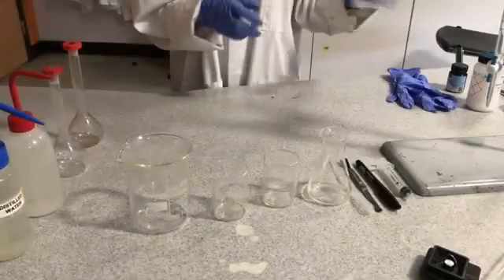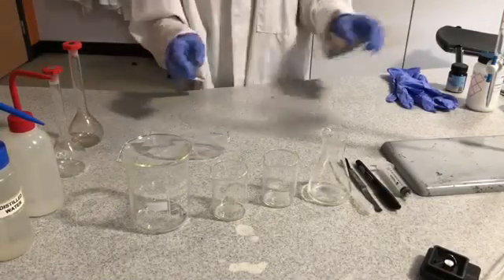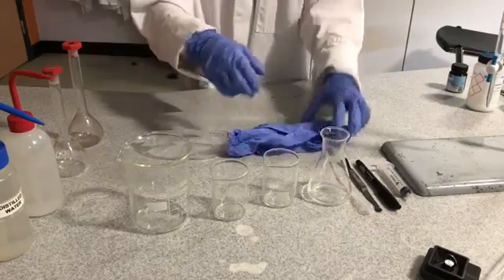This is a demonstration to show how to do a titration to analyse the vitamin C content of ascorbic acid, which is a vitamin C solution. Please use the personal protection equipment provided as directed by your tutor.